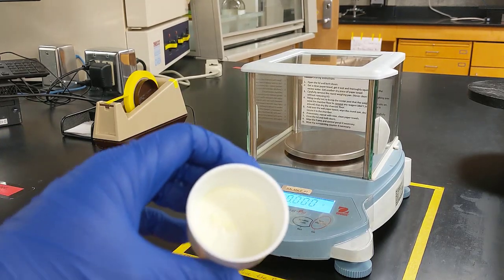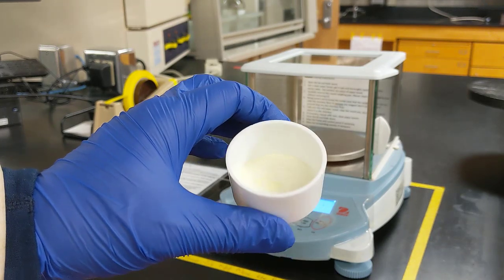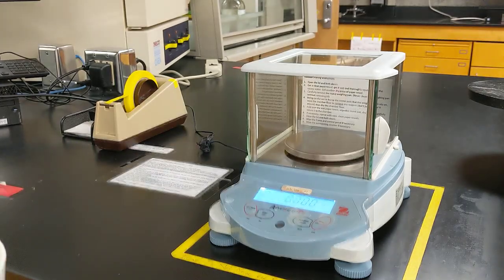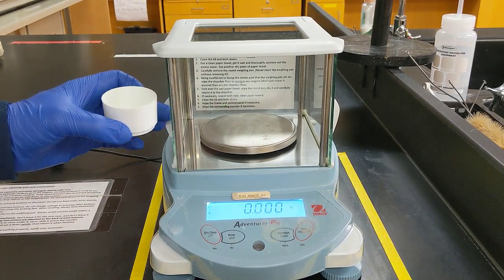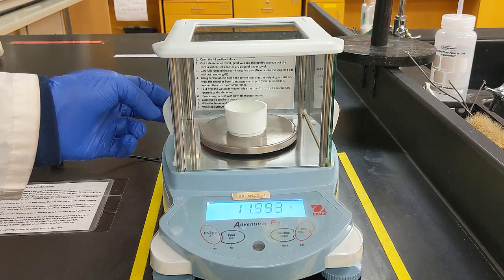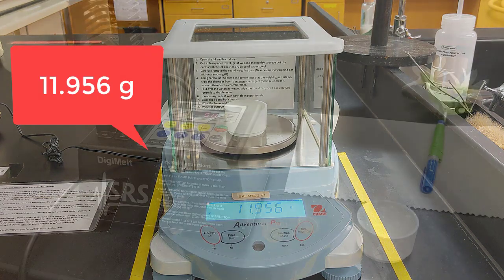Alright, so I just pulled my product off of the Buchner funnel, and you can tell it's kind of a yellowish, off-white yellow, fine crystalline powder right now. What we're going to do is put this right back up on the scale and subtract the mass that we determined before for the Buchner funnel and the filter paper. Alright, so it looks like our new mass is 11.956. So let's record that for our lab data.